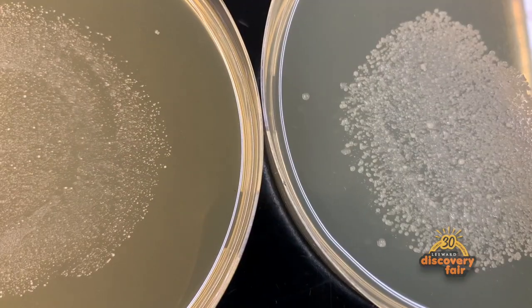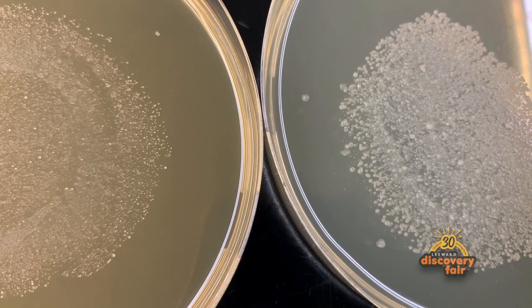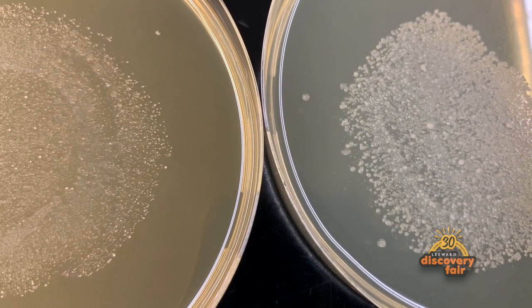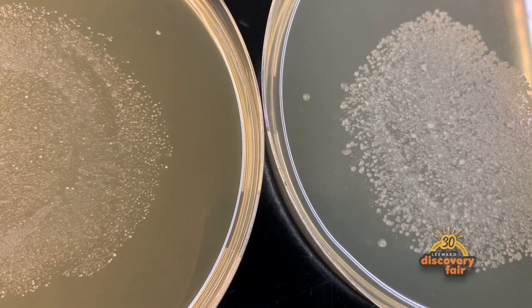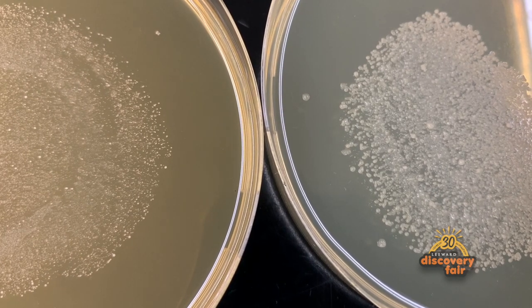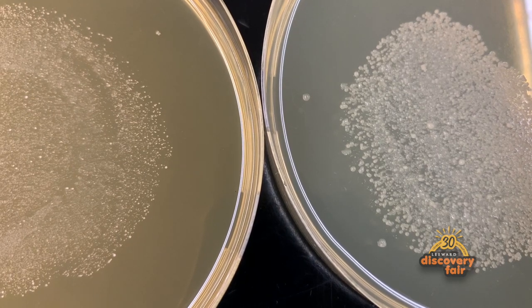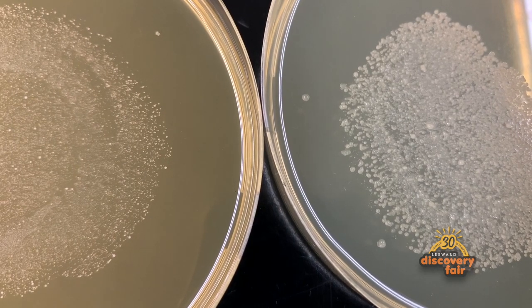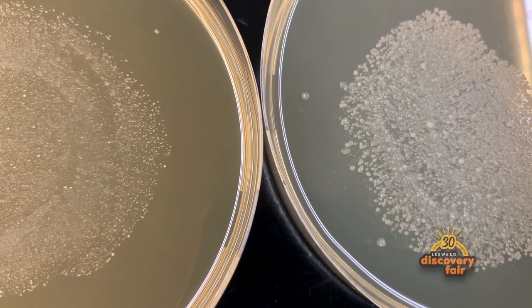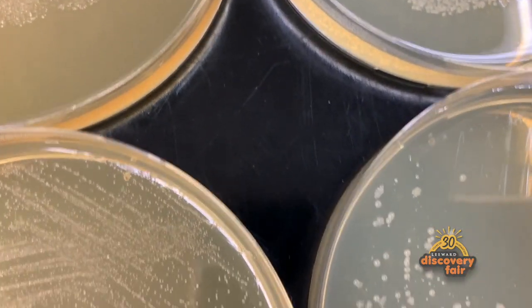A closer look at the plates allows us to see these things we call colonies. This is what happens when bacteria grow many, many times over the course of one night and they form these large visible mounds. On the left, we have the bacteria growing on glucose. On the right, we have the bacteria growing on sucrose — and remember, that's the sugar from candy. I grew it a different way where we can see the colonies a little bit better by themselves.